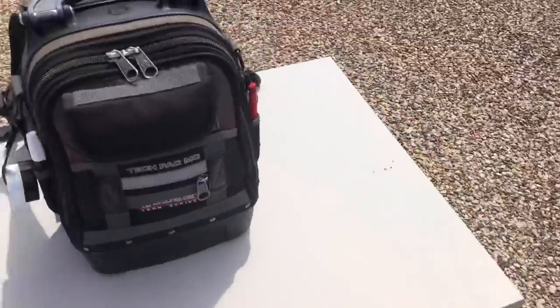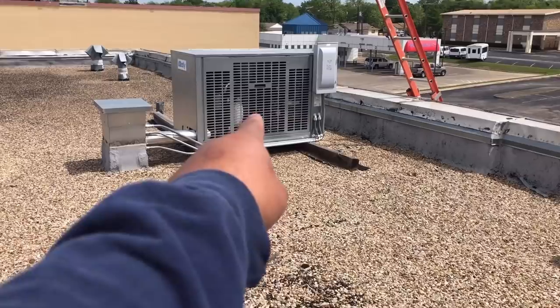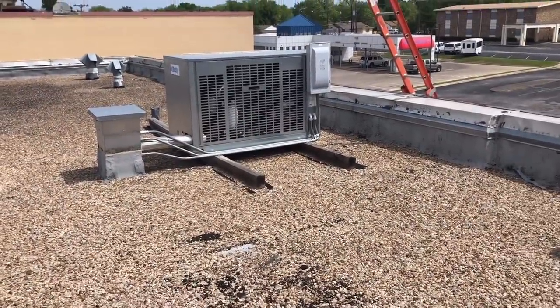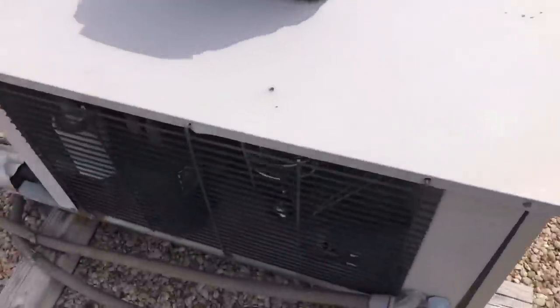This place is the plasma place. You all remember I had that unit that had a short — found a couple wires rubbed out inside in the evaporator. So we're back at this place.